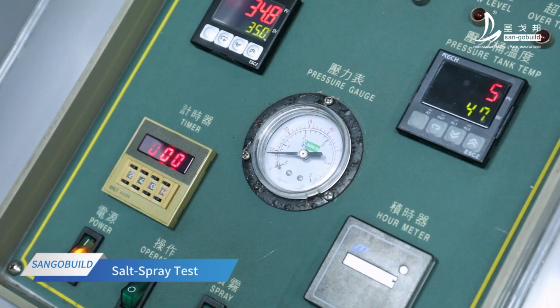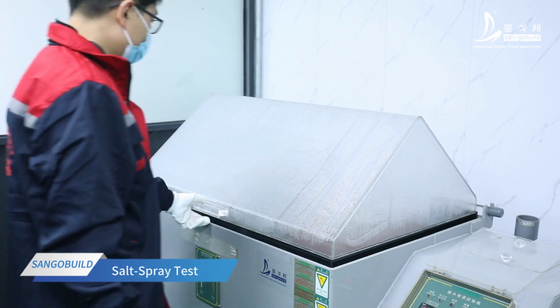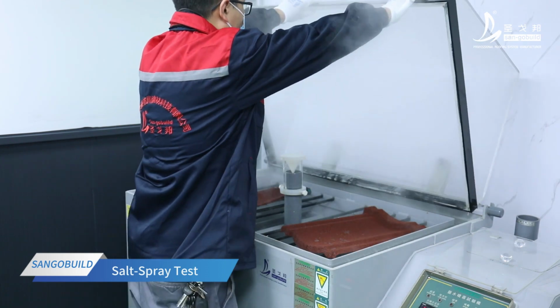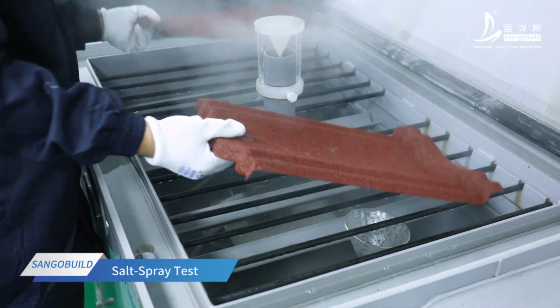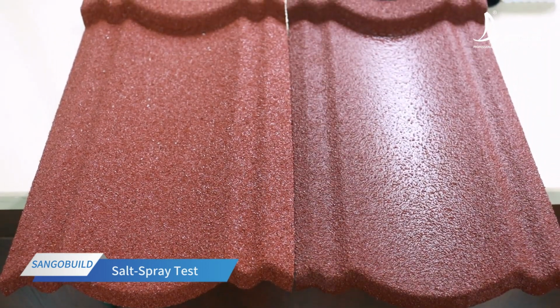After a period of testing, the laboratory technician compares the sample with the untested sample. The sample of stone-coated roof tile has no discoloration and no corrosion. Pass the test of salt spray alkaline environment.